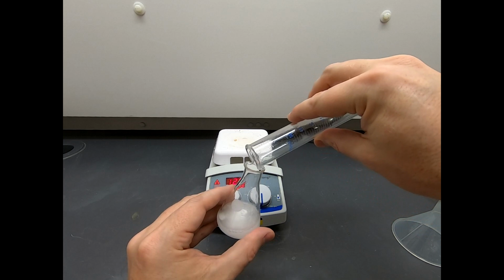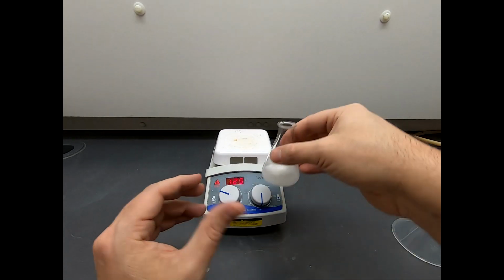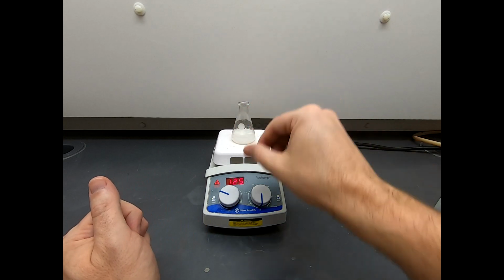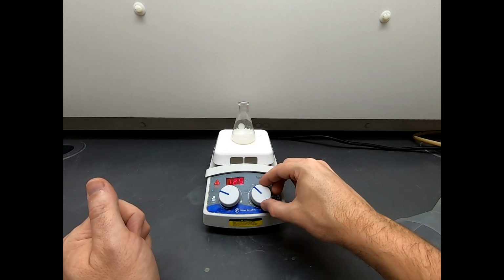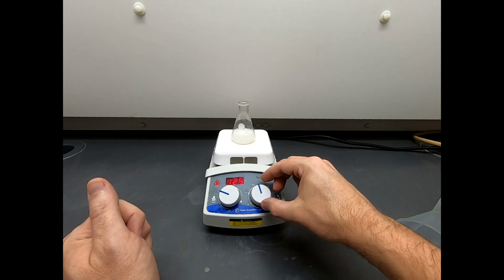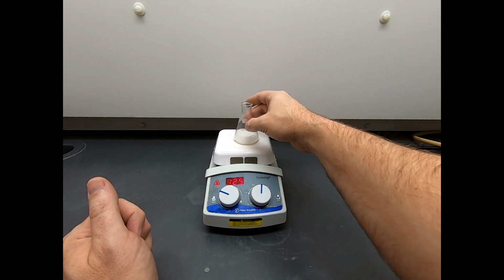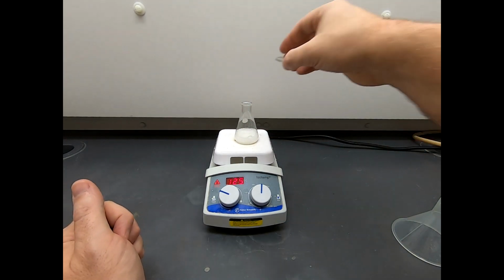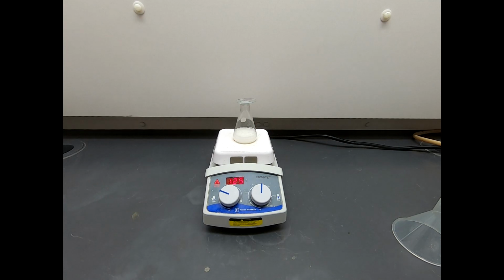Okay, so I'm just pouring that in. That's 15 milliliters. That is concentrated nitric acid. Let's go on to the hot plate. Let's stir that a little bit. And goodness, that's it. So I have a little bit of agitation going in there, which will be fine. Since I'm heating it, I'm going to put a little watch glass on top. And we're just going to let this heat and stir.